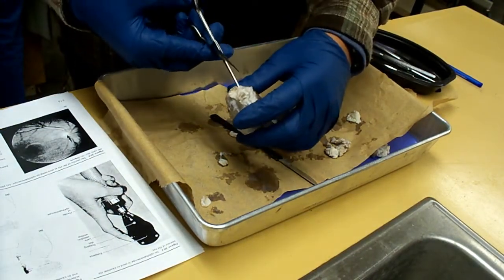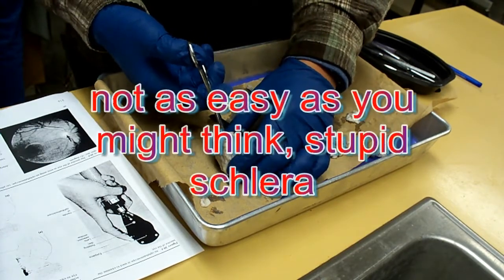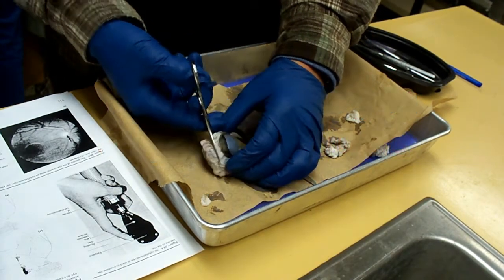No, we have to shove in the scalpel first. With where? The scalpula? Scalpel. Like scab, is that a bone or something? Scalpel, whatever. Oh, there it got it.